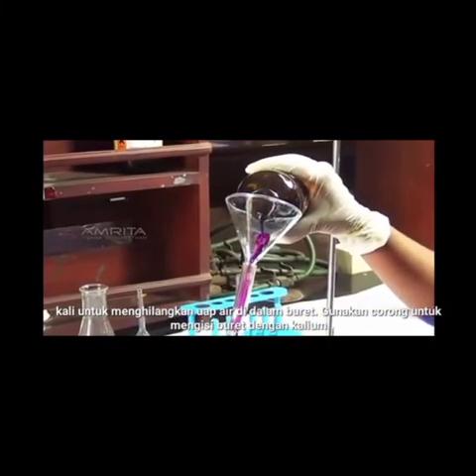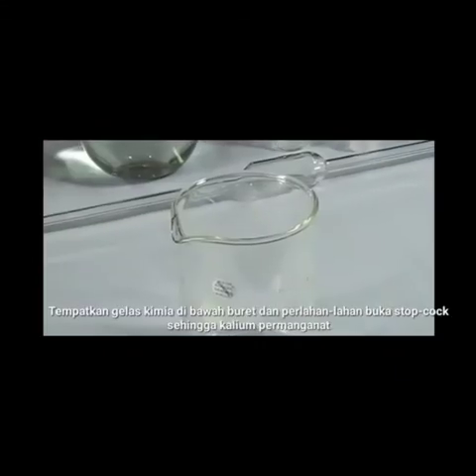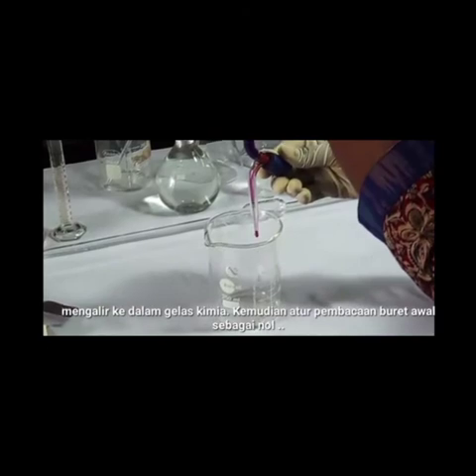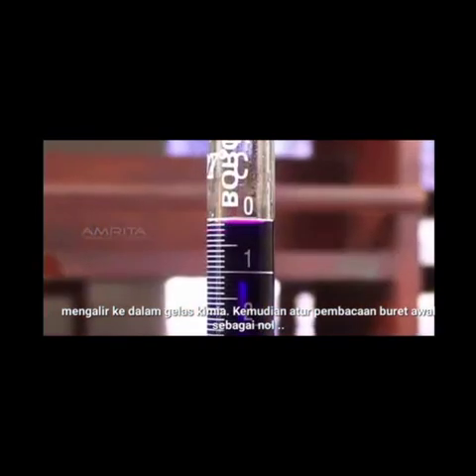Use the funnel to fill the burette with potassium permanganate solution to just about the 0 mark. Place a beaker below the burette and slowly open the stop cock so that the potassium permanganate flows into the beaker. Then set the initial burette reading as 0.